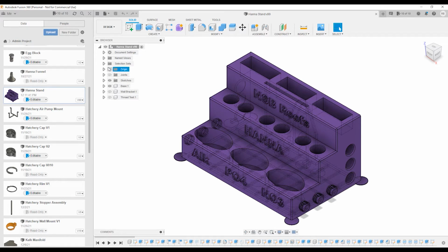selection sets, expand your choices, and here's where I've hidden all the options. Now this model supports alkalinity and calcium, and then everything else. The alkalinity and calcium are different in that they include liquid reagents, and the calcium option also has powder packets to go on top of it. So within any combination, those are represented here.